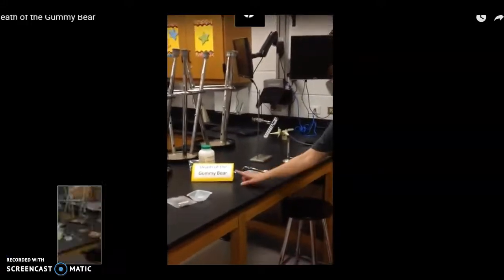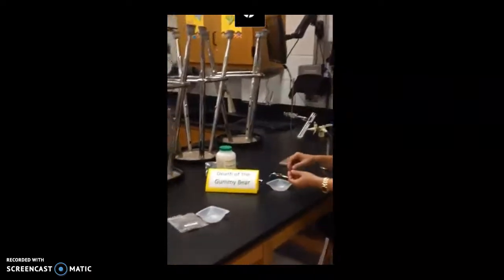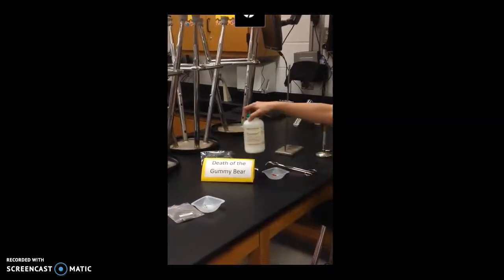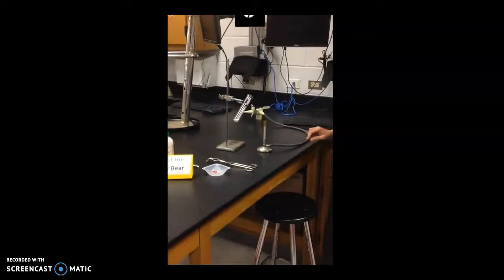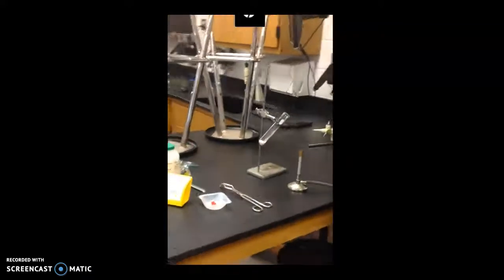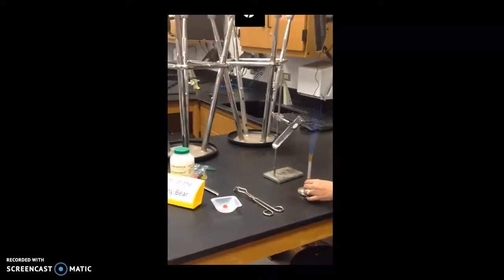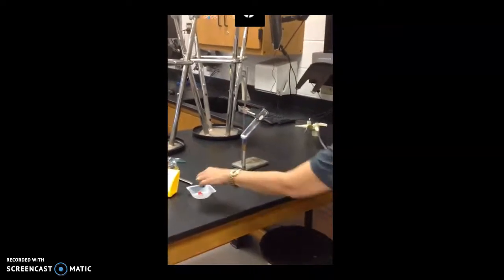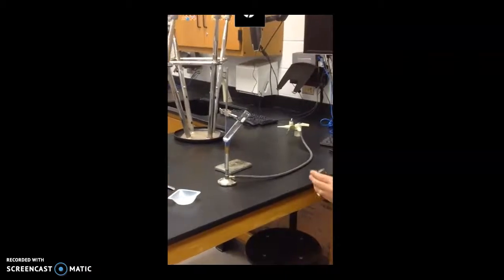The next one is the death of the gummy bear. And of course, the main star here is Mr. Gummy Bear. In the field of science, we just have to sacrifice, all right? Also have potassium chlorate, which I place inside this test tube right here. Basically, all we have to do here is to heat it up with a very high flame so that it will start to melt. And the moment that it starts to melt, we just have to drop our gummy bear right here. And I want you to observe what will happen.